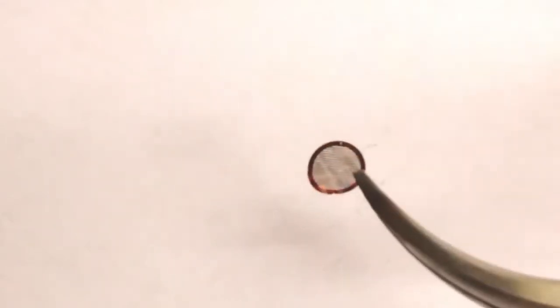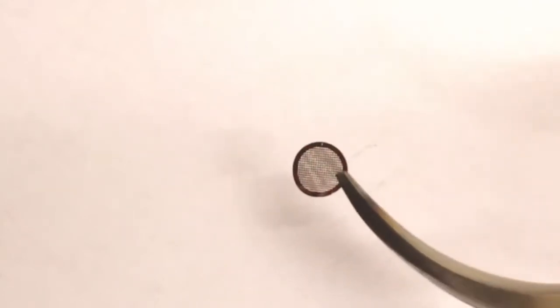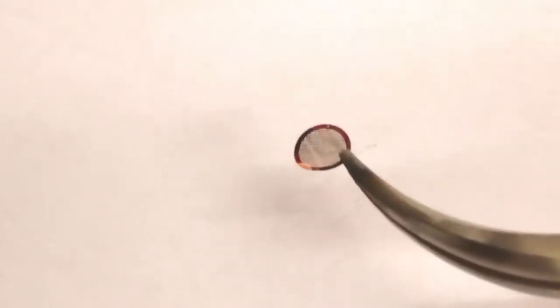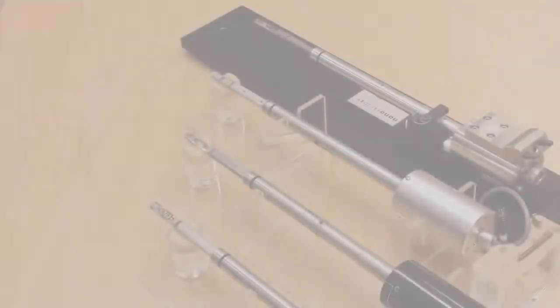If you have, for example, a solution-based particle that you want to study, nanoparticles of some sort, then the easiest way is to just drop the solution onto this grid. Then the particles will stay on the carbon film and they will be easily monitored in the TEM.